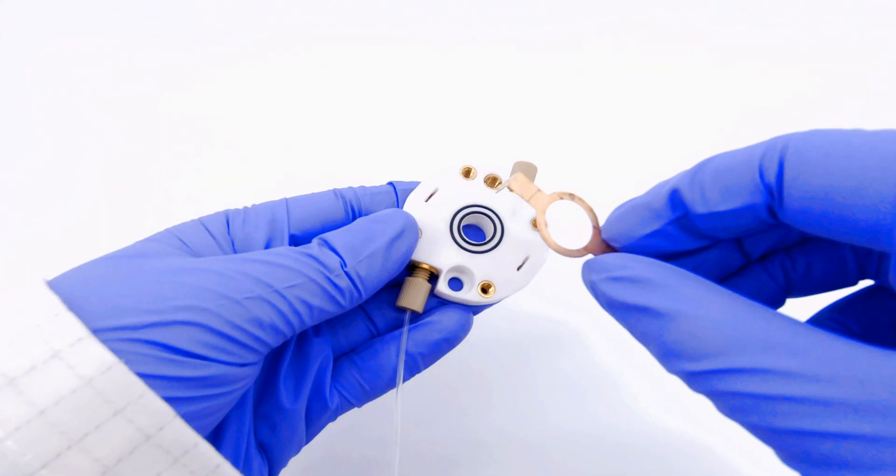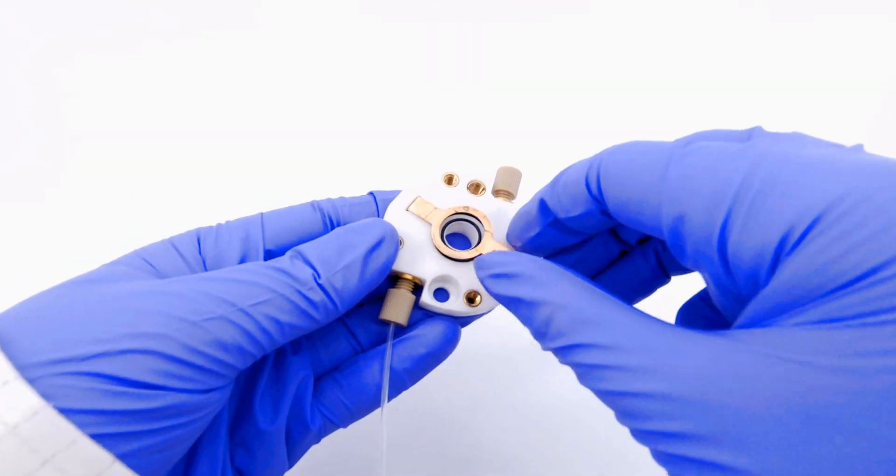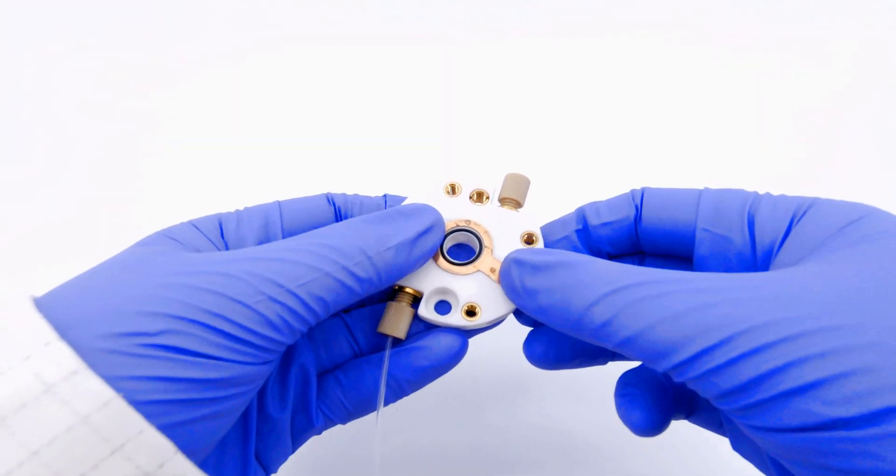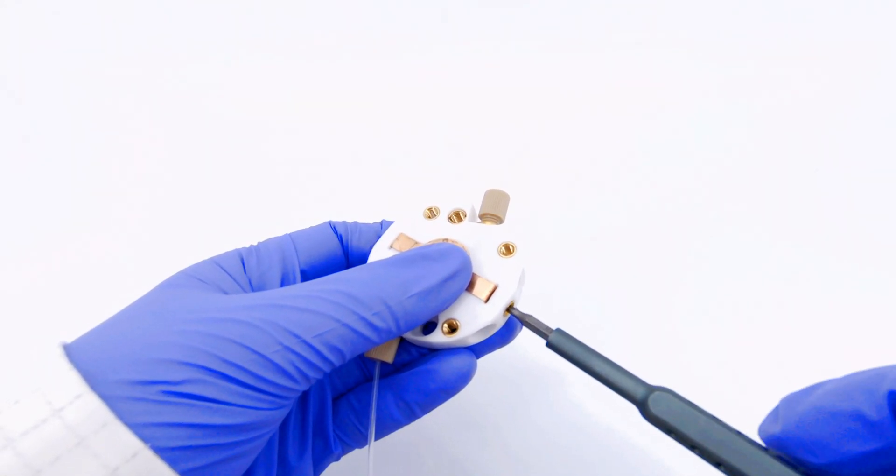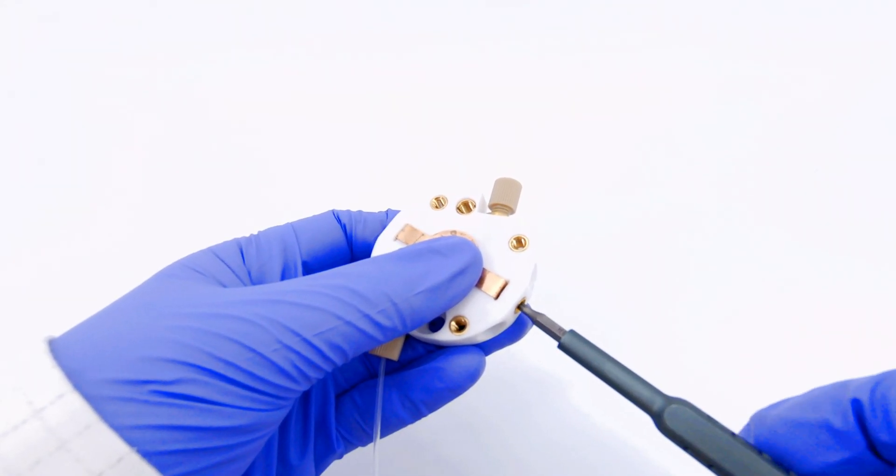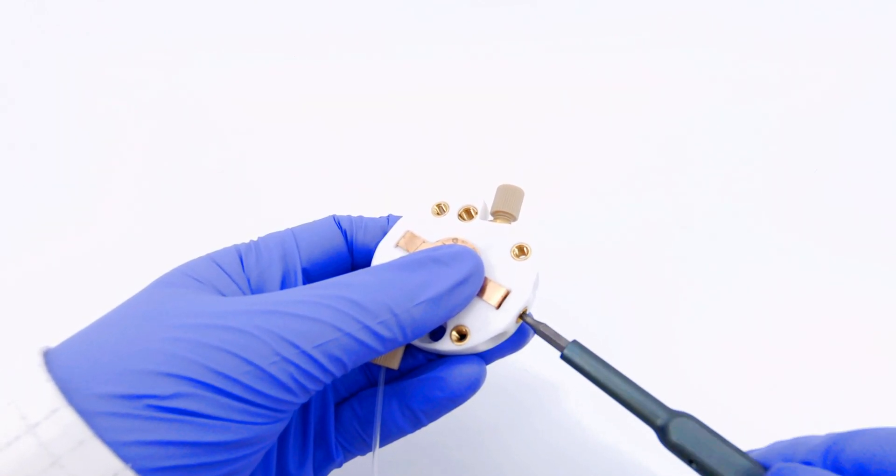Firstly, place the tabs of the photo electrode contact into the slots of the PTFE chamber. Secure the contact by tightening the hex bit grub screw from one side and tightening the photo electrode contact banana plug from the other.